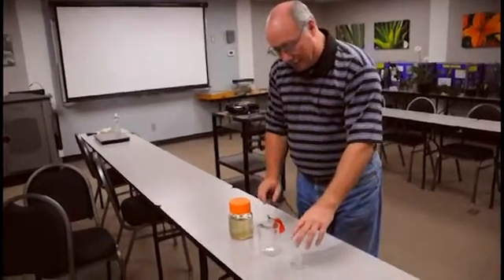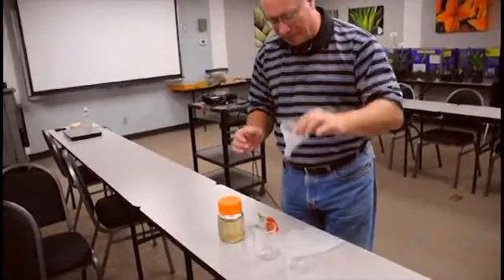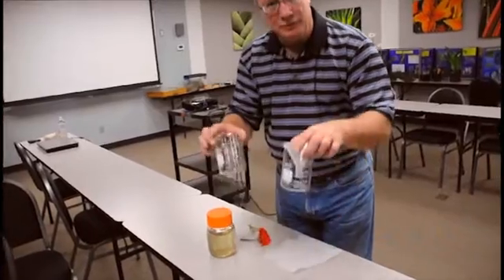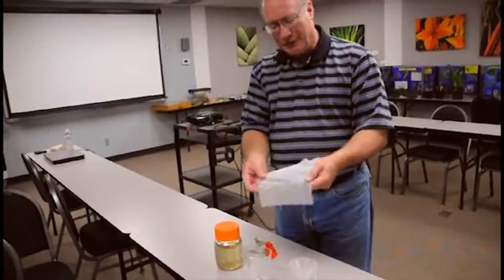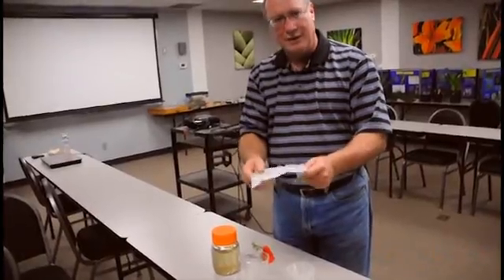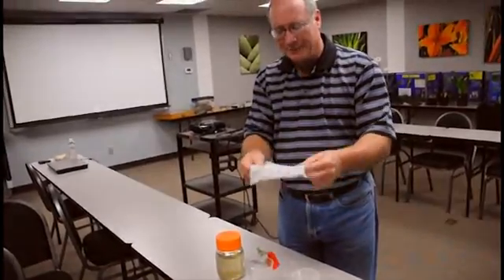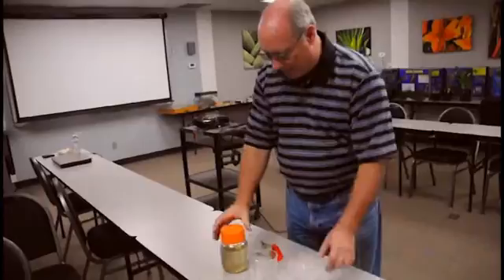So what I've got here is just a little funnel, you can get the funnels almost anywhere. Now I have beakers, but you can use jars, it doesn't really matter. And just a piece of screening material, this is probably polyethylene, it could be polyester or something like that, but very fine screen. And then some ethanol.